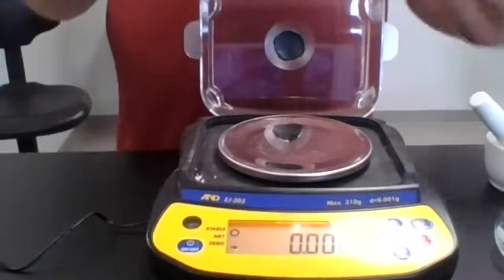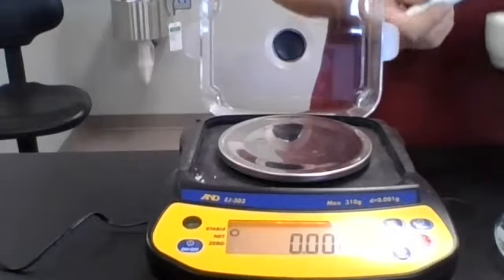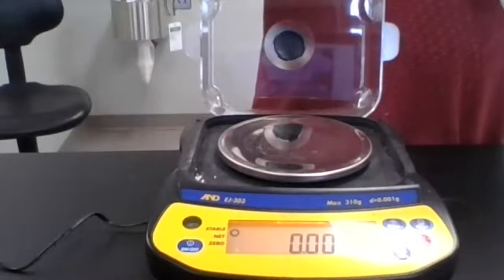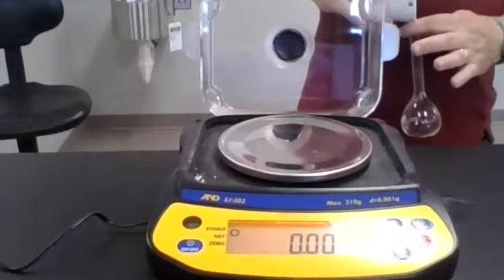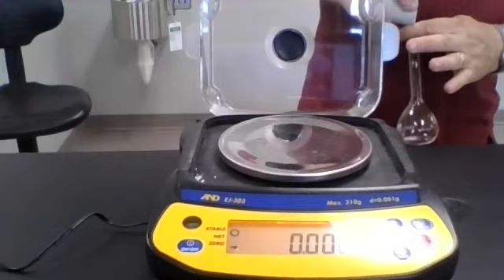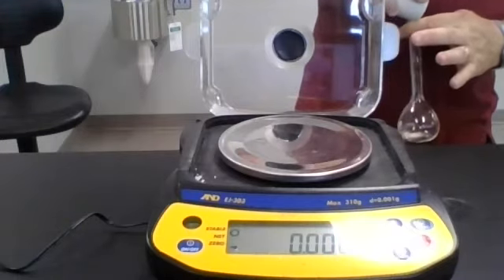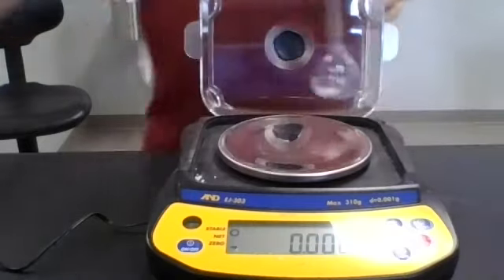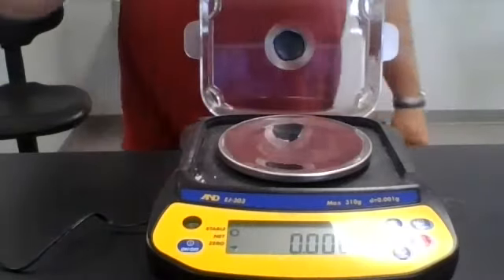All right. Now I am going to transfer this powder into the flask, as you see here. Now, some of you may think, is he going to spill some of that? You know, I might. I might even spill some of that on purpose, although I wouldn't do that on purpose in this lab. And when I do that, I find that I can now determine the mass of the iron tablet that I got in there.